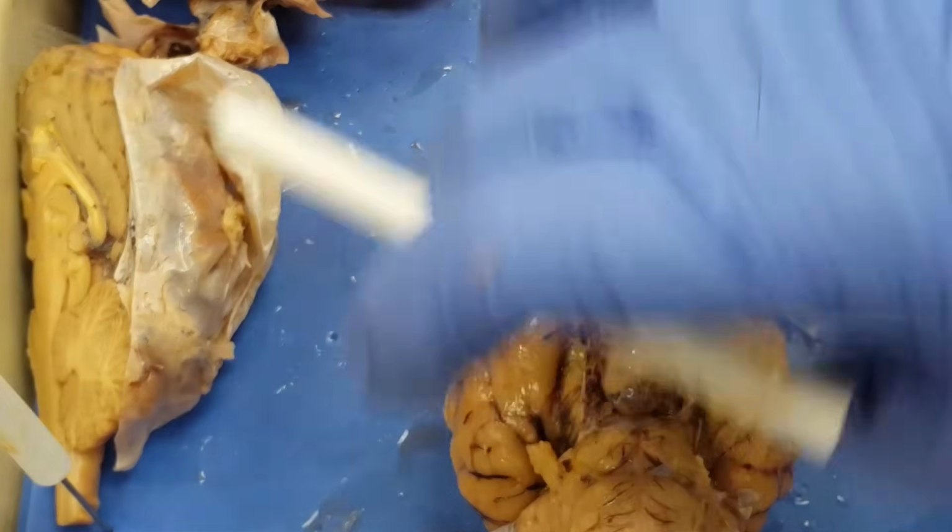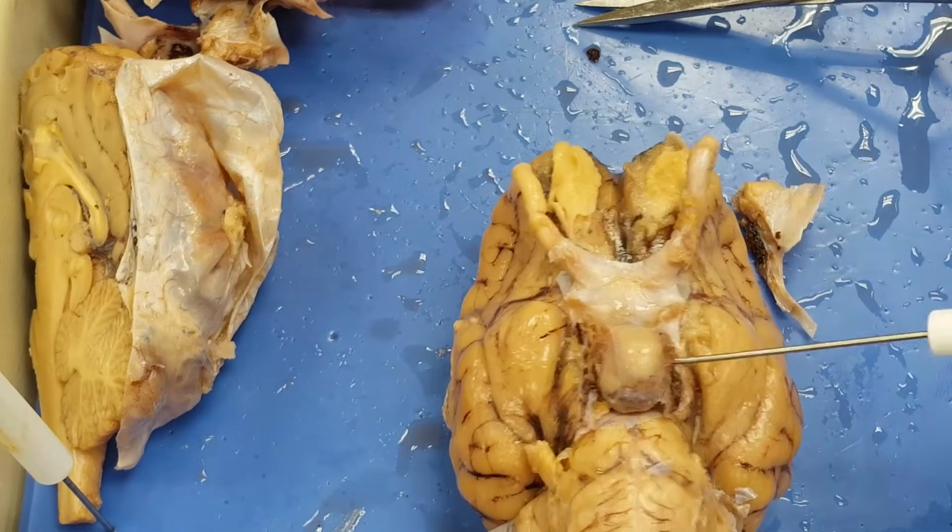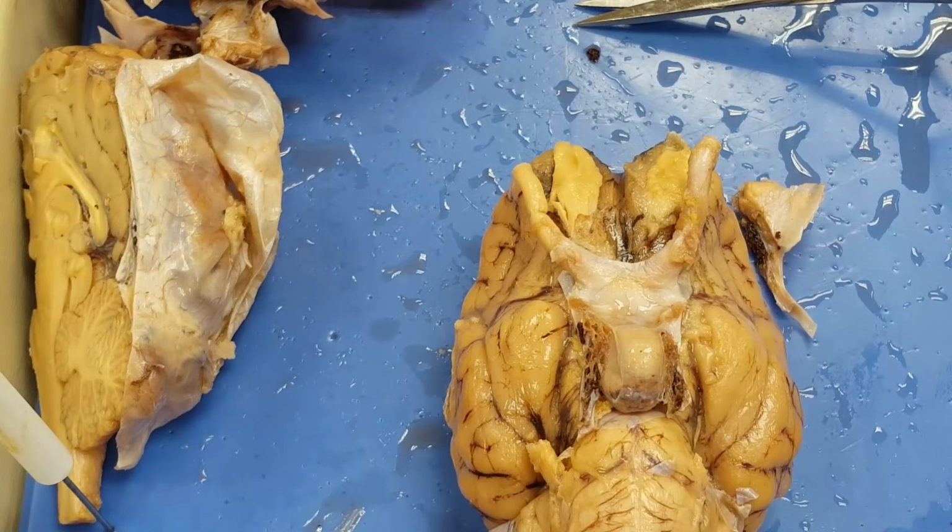This again is that pituitary gland, kind of rare to find in a lot of these brains because when the brain is removed from the skull, the pituitary gland actually hooks on that sella turcica lots of times and gets ripped right off. So make sure you're going through these structures in this instructional section and in the practice video. Because it's brains, and dead brains are just cool.